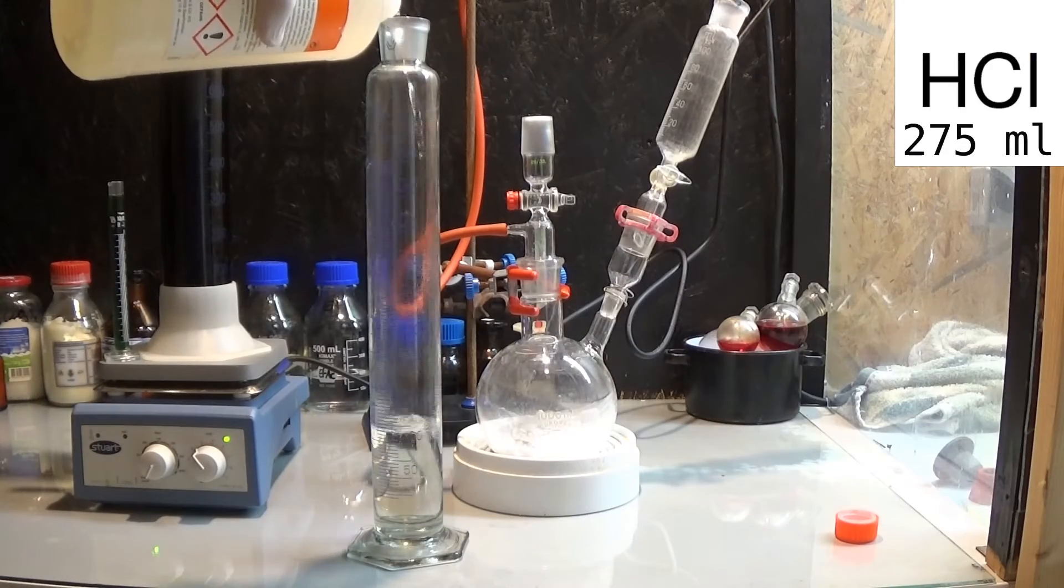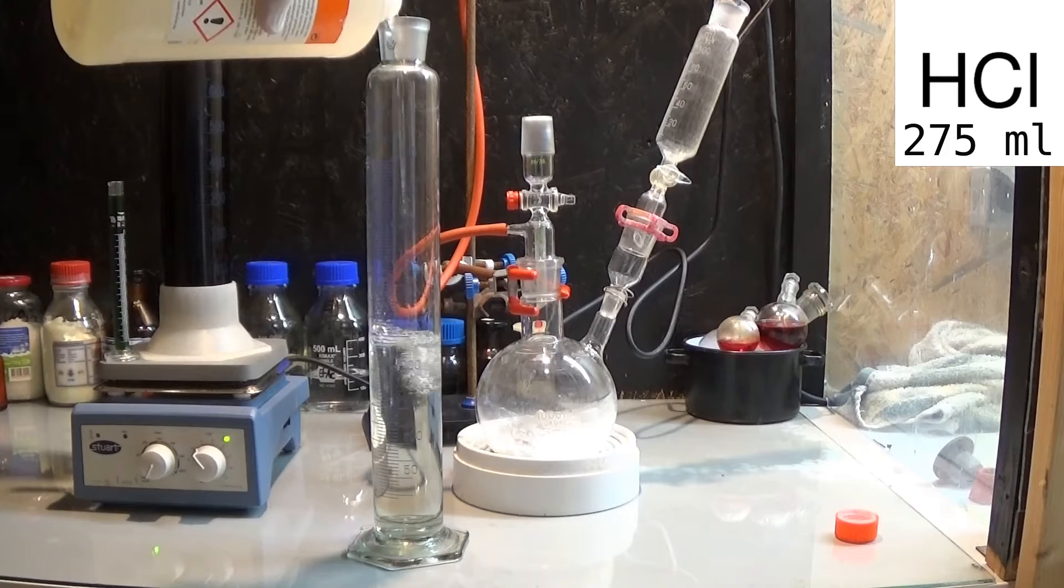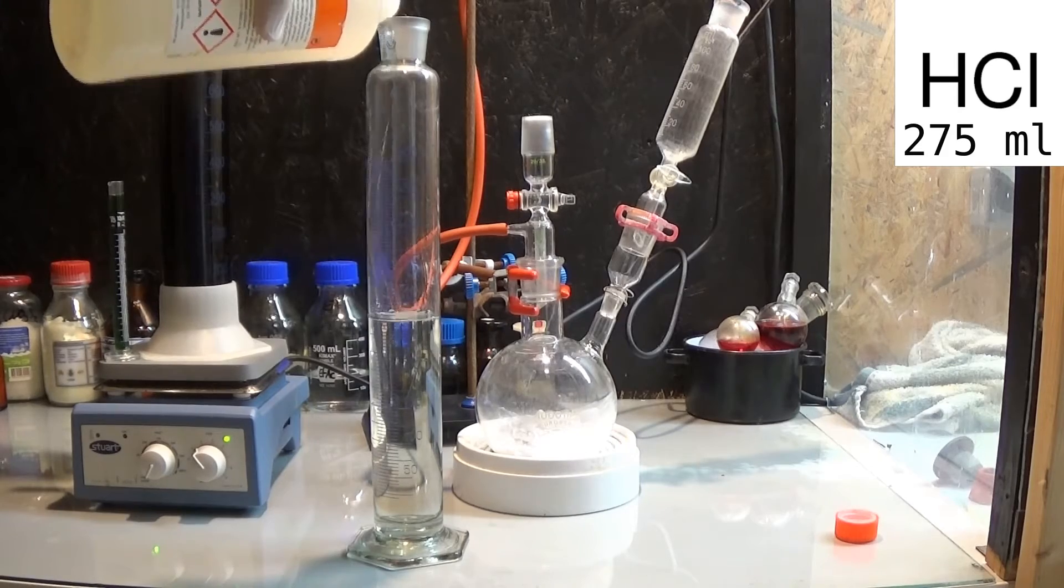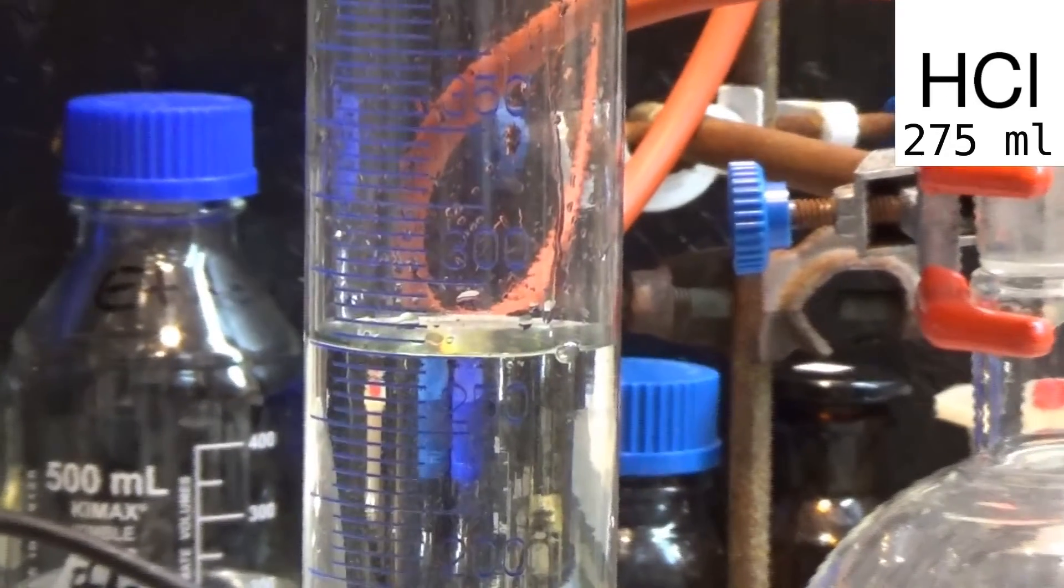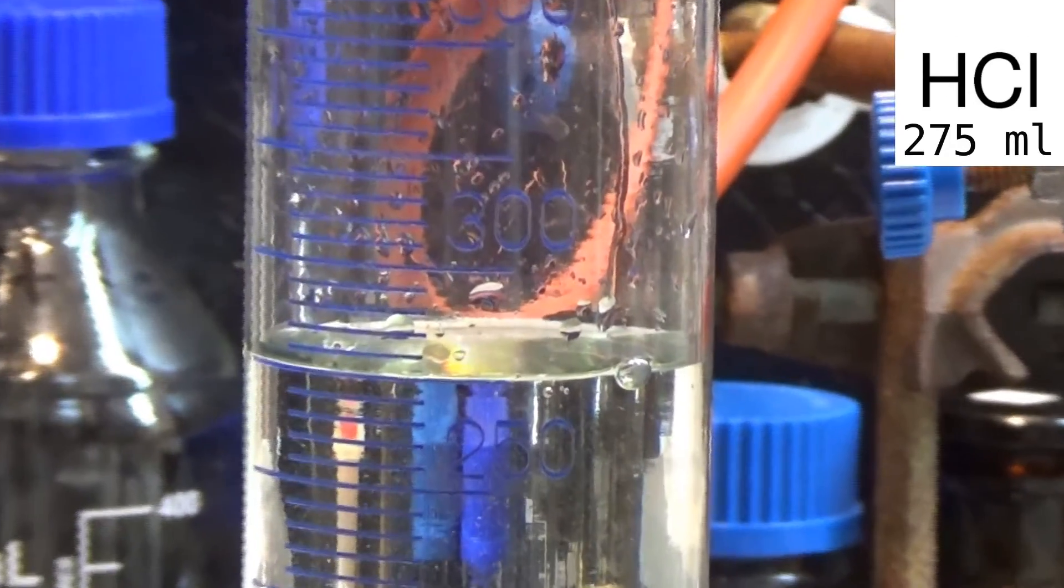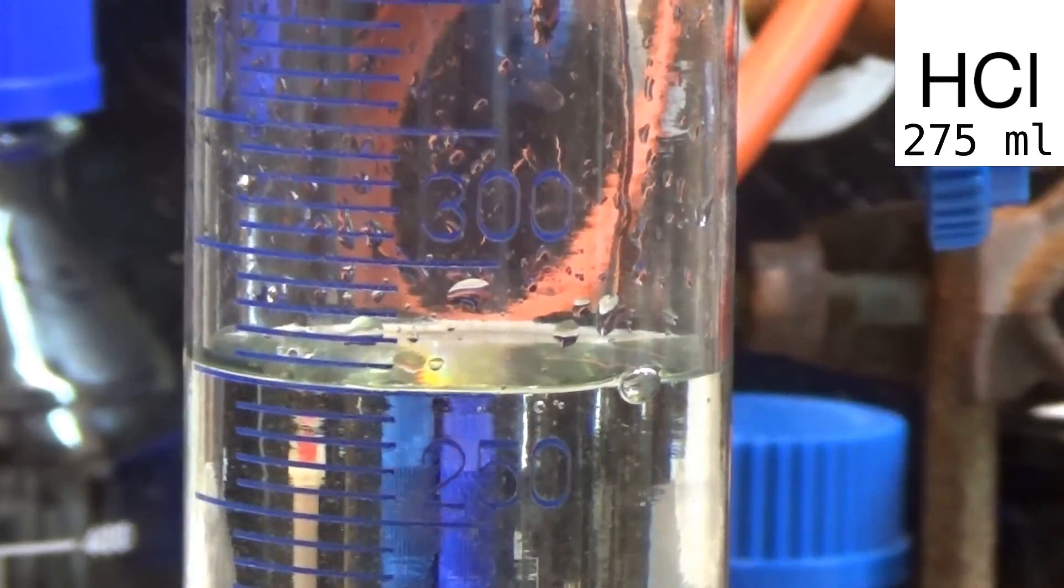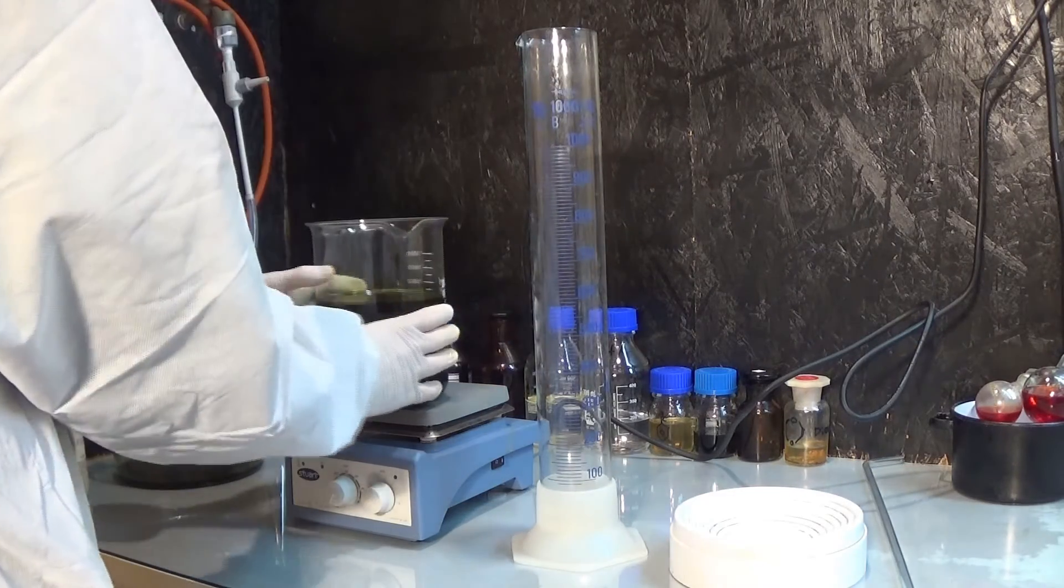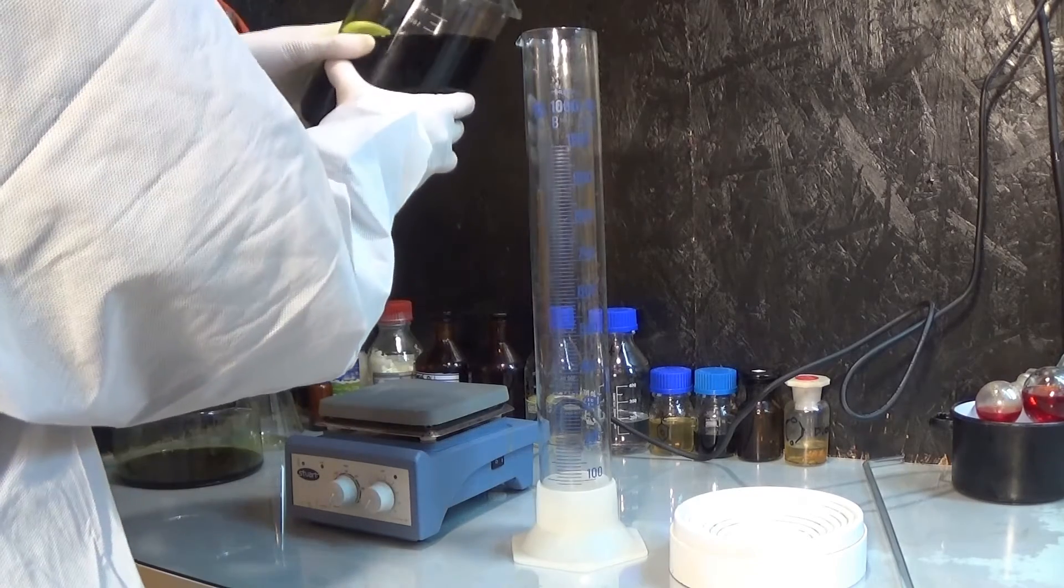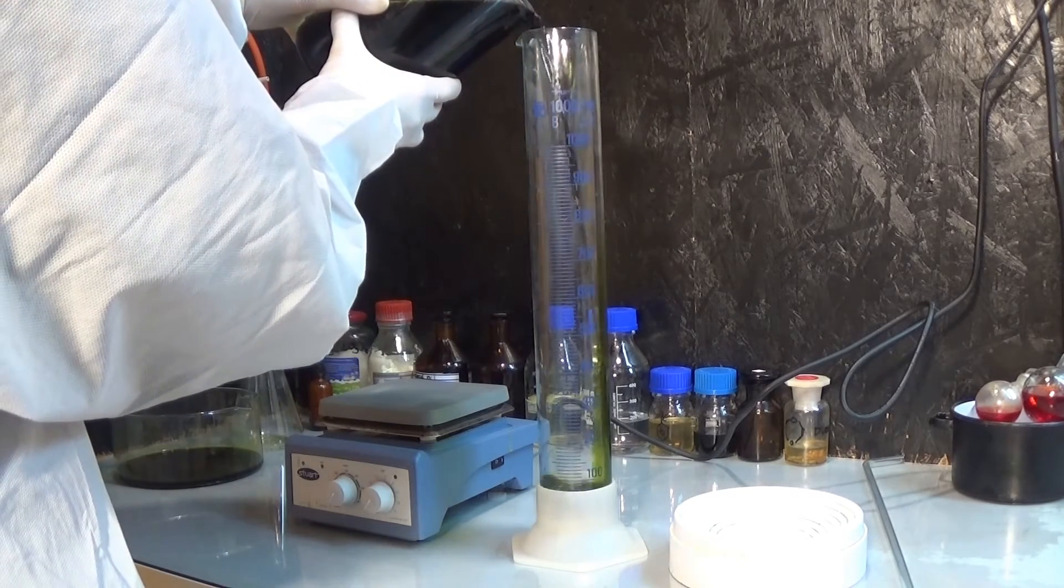Measured the right amount of HCl out. Filled the iron 2 chloride solution in a high cylinder for better containment of the chlorine and to give it more time to react with the solution.